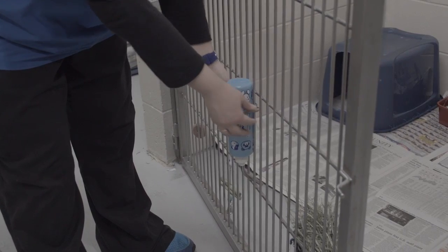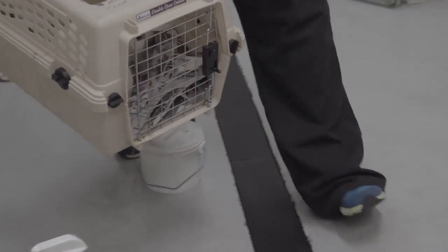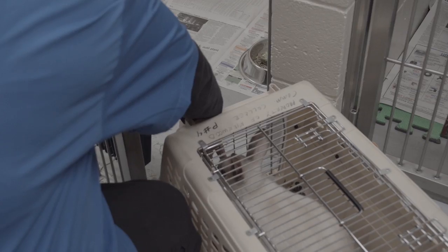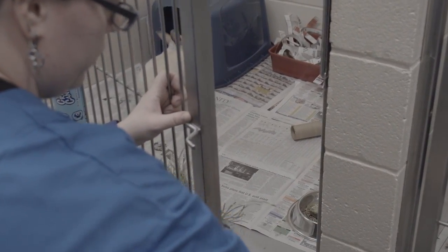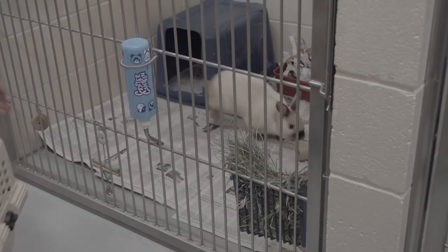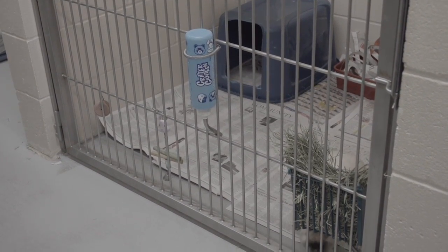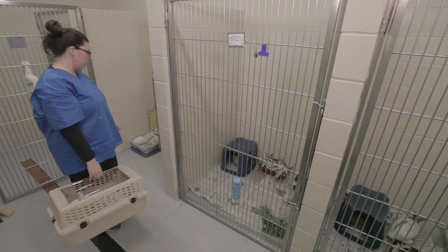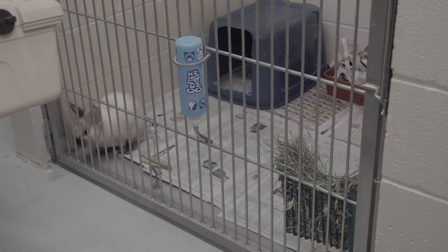And then in the mornings, they get fresh fruits and vegetables. Put them back — it's ready to go. And then you can just open the cage and let them back on in. Make sure that's secure. Make sure they have a chew block to gnaw on, some toys in there to entertain themselves. And then you'd refill the supplies: the stacks of paper, towels, hay, litter, Timothy cubes, pellets, etc. And that, my friends, is spot cleaning the bunny cage.